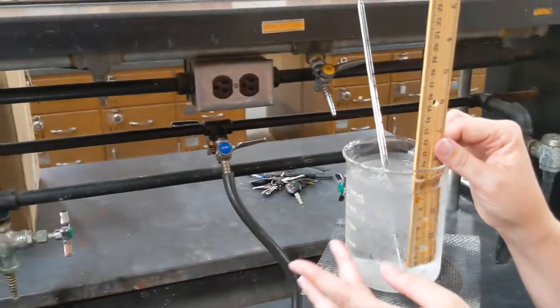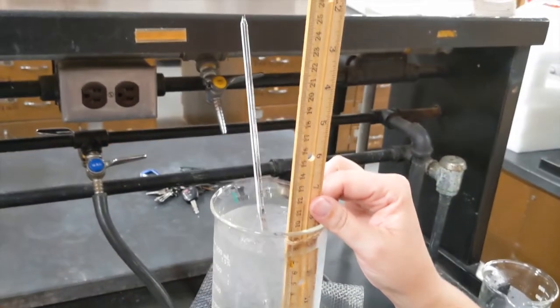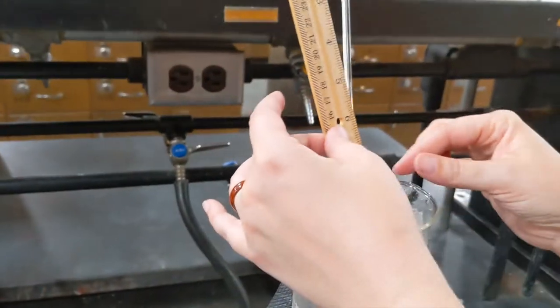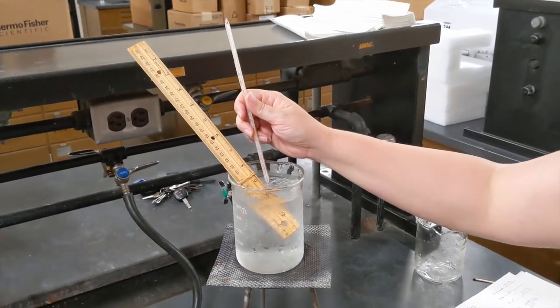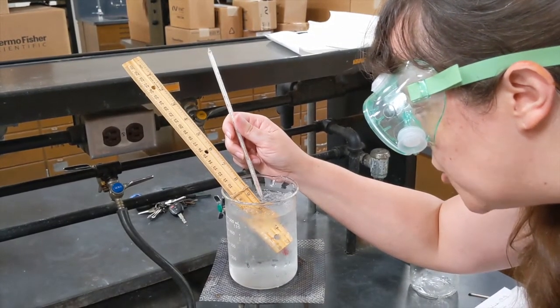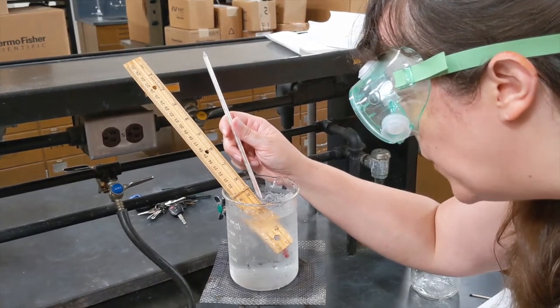I'm going to have to get down here pretty close. Looks to me like I have, I'm going to call that 6.49 centimeters. All right, let's get the temperature in the ice bath. It's not going to be exactly 0, and you'll talk in Chem 124 about the colligative properties that make this temperature not exactly 0. That being said, it's really close. I would say that is 0.01.